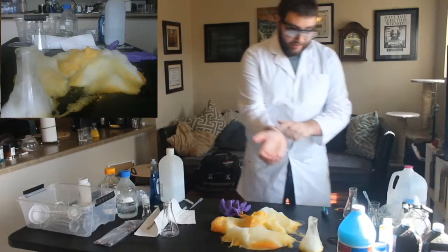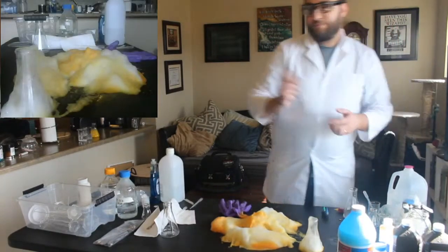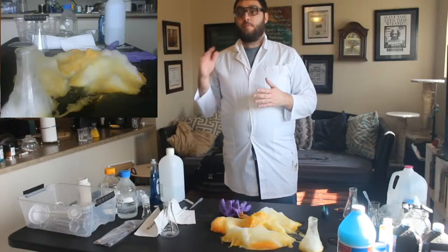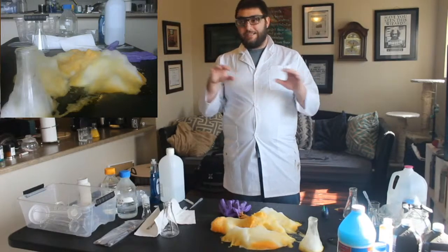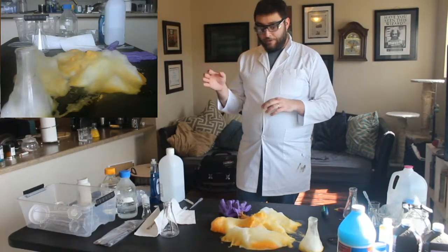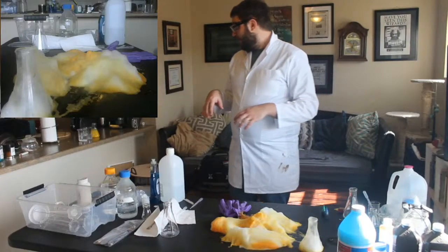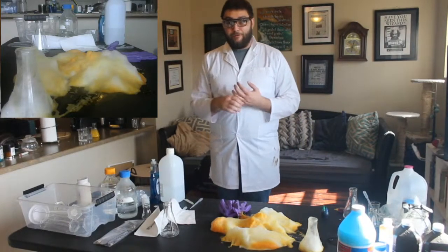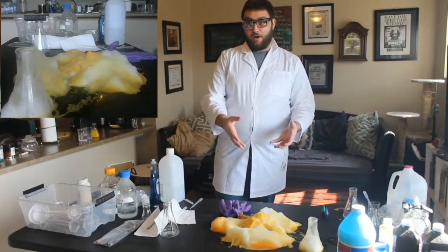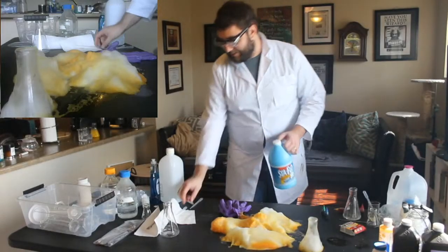You can see I got a little bit of it on my arm, and it turned me a little bit orange. That's because we were dealing with the iodine. Remember, when it goes from iodide to iodine, iodine is orange-brown. So one thing we could do is take a little bit of our starch that we were dealing with before and combine it with this stuff, and it would turn bluish black. In fact, why don't we try that, because that sounds really cool.